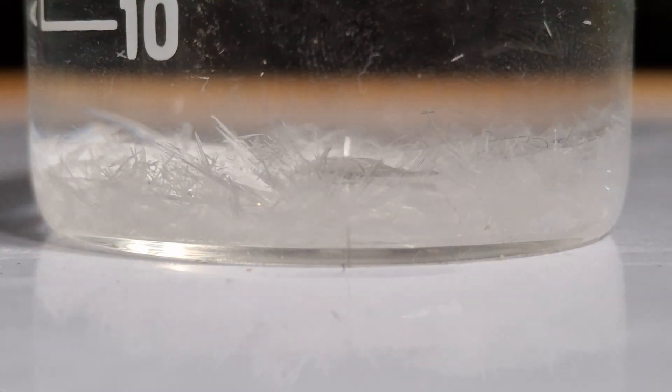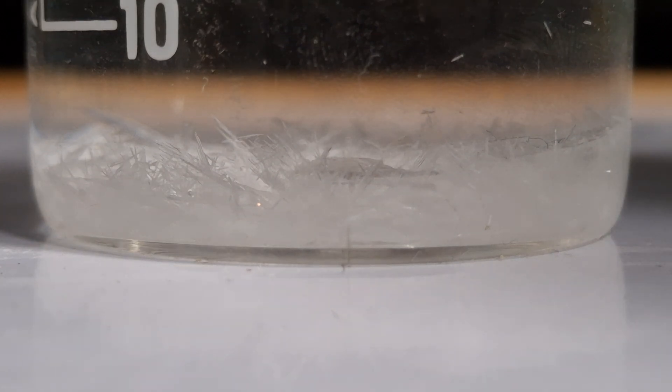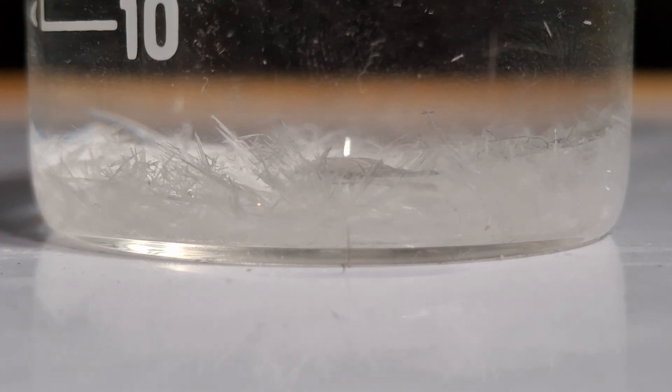These are crystals of benzoic acid, a common preservative, and this is how I made it using materials obtained from the supermarket. Watch till the end to see how the crystals were made.